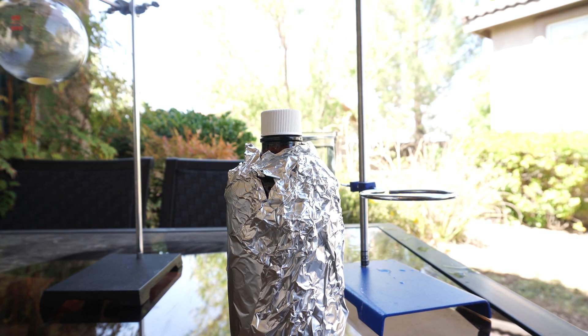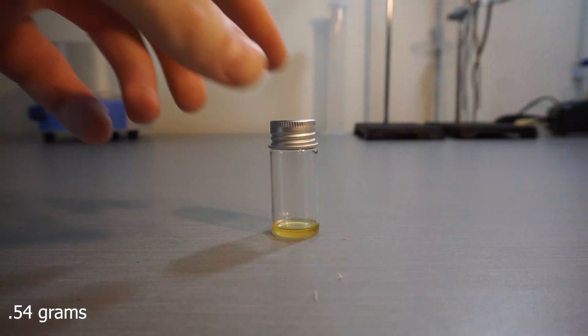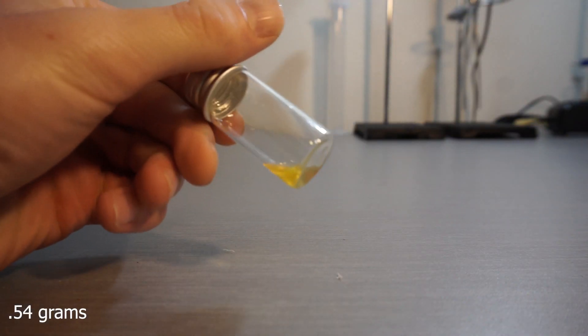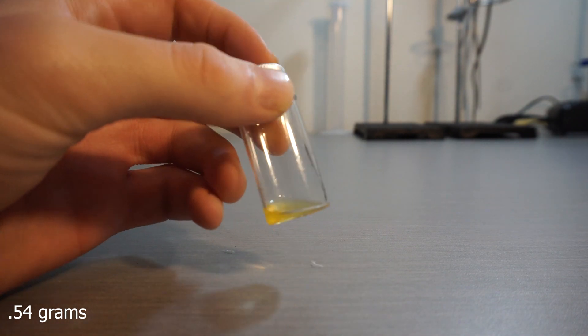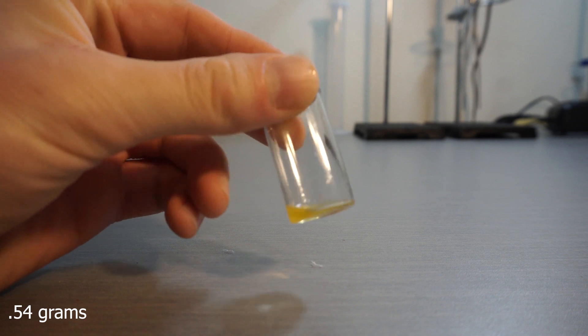In the end, I was able to recover 0.54 grams of almost pure cinnamaldehyde oil. In the future, I plan on doing a really cool clock reaction with it known as the cinnamaldehyde clock reaction.